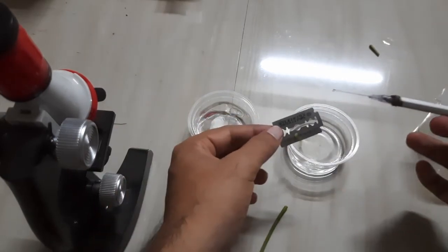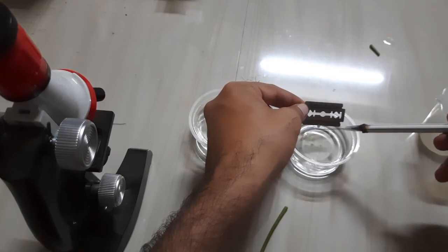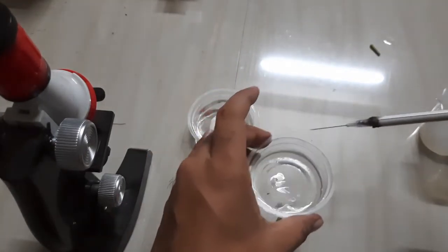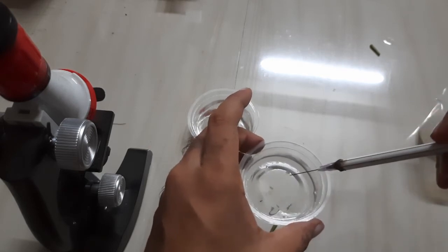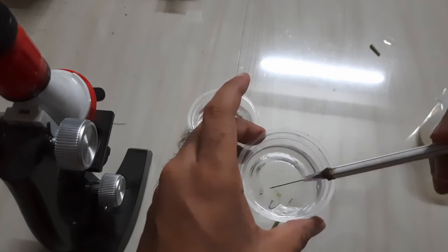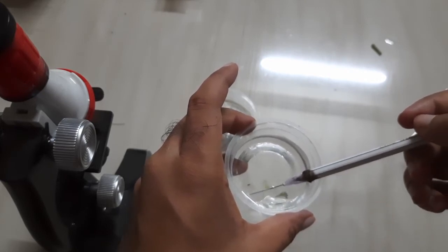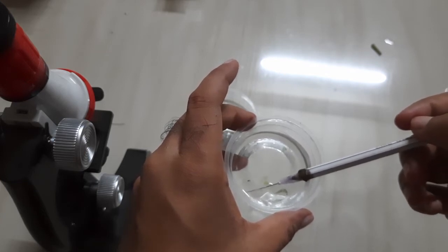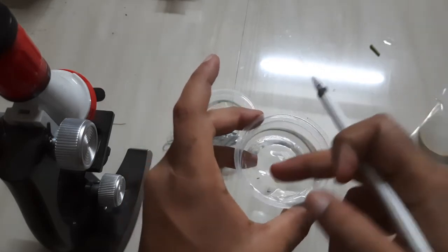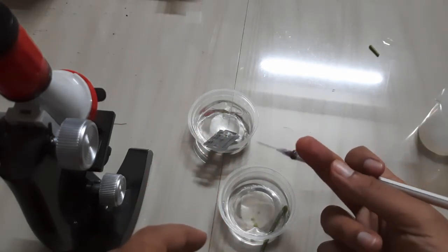So how to find out which one is the thinnest? We have to place the sections on water and observe which specimen is the thinnest. Generally the thinnest specimen will float on the water. This one is floating — that means it is the thinnest. Obviously if you disturb it too much it will sink. So like that way you find out the thinnest portion, and light can pass through it easily.